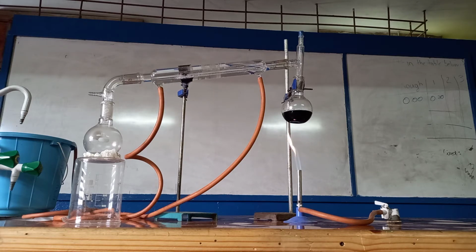And of course, while you're watching, you can feel free to skip ahead. Alright, because this is what will happen. So, alright, I'll pause it here and then we pick up when we reach a little further.